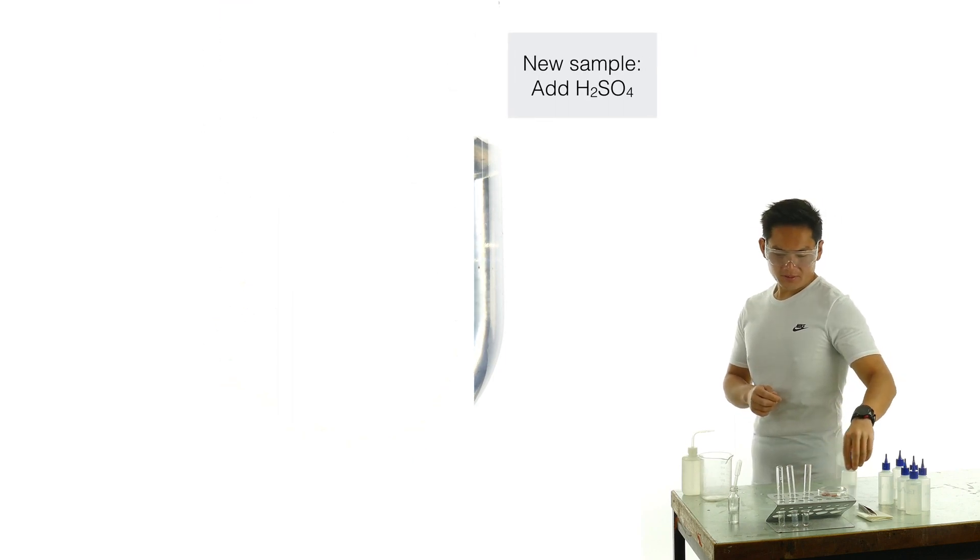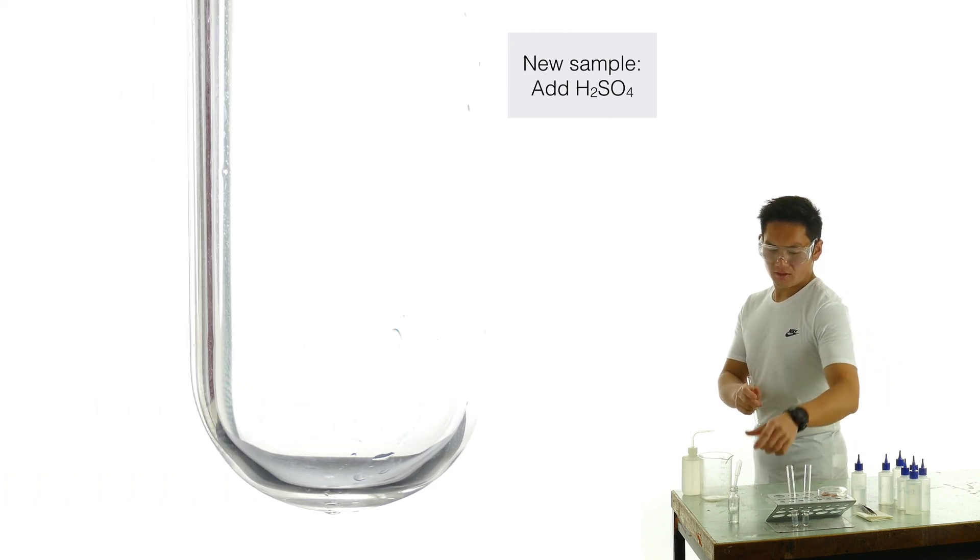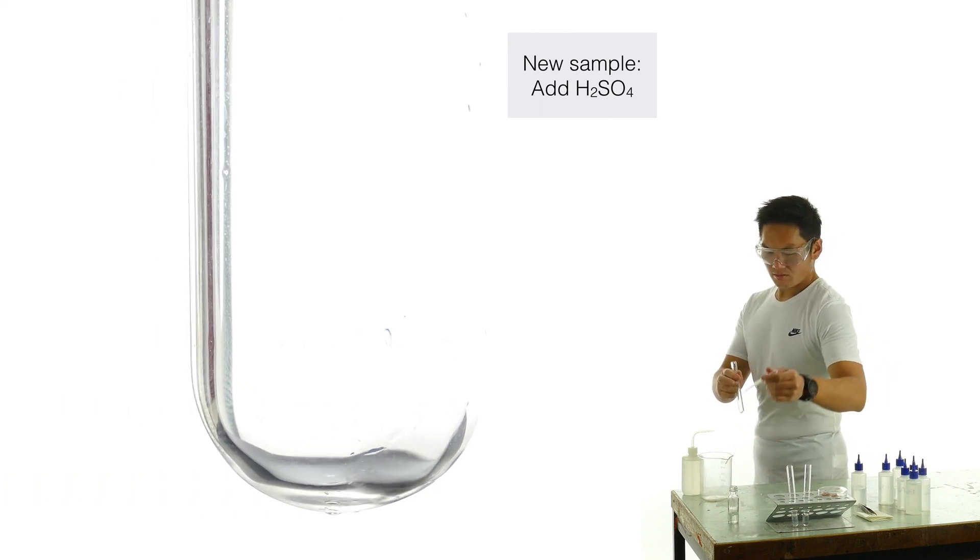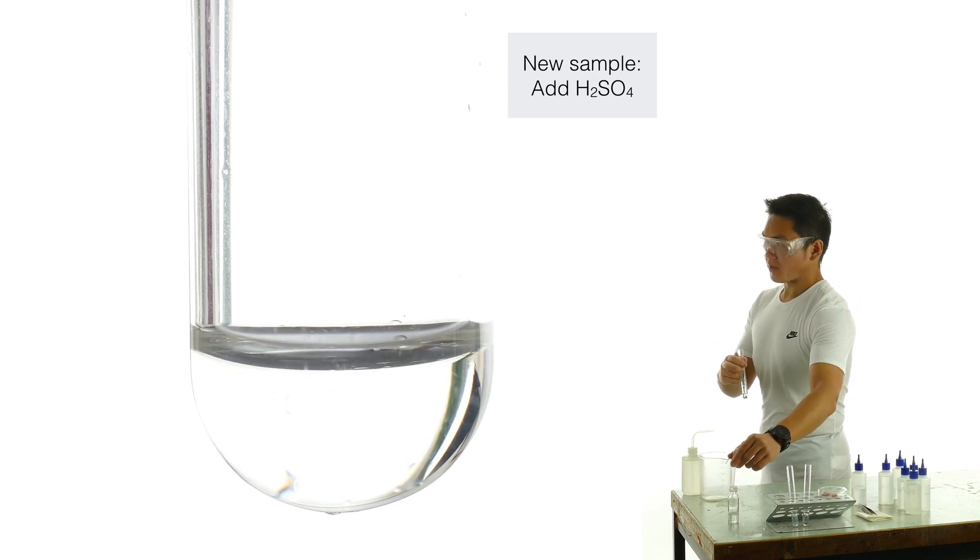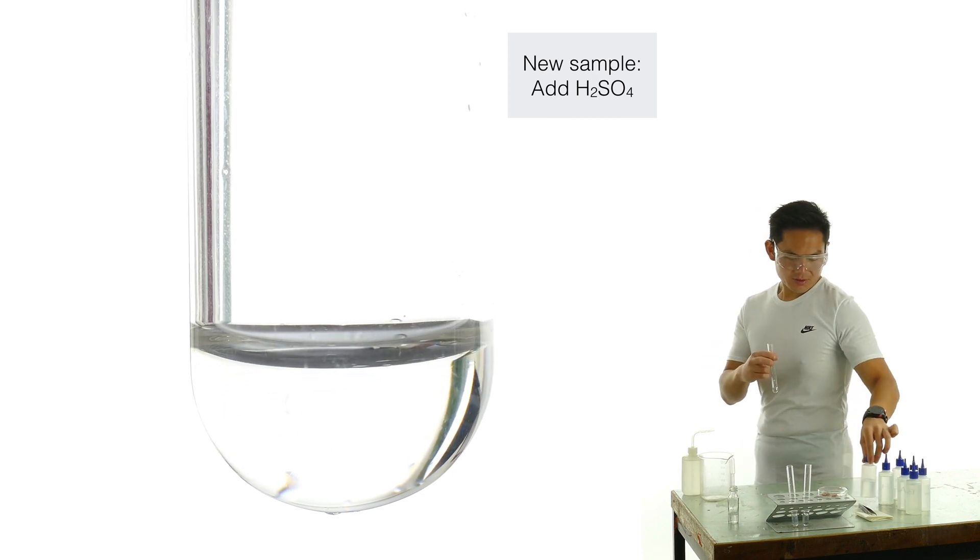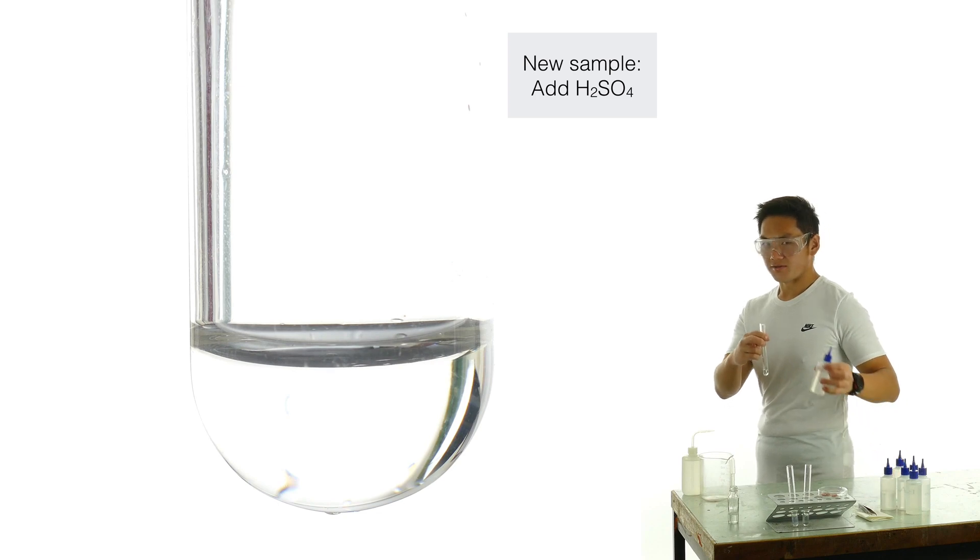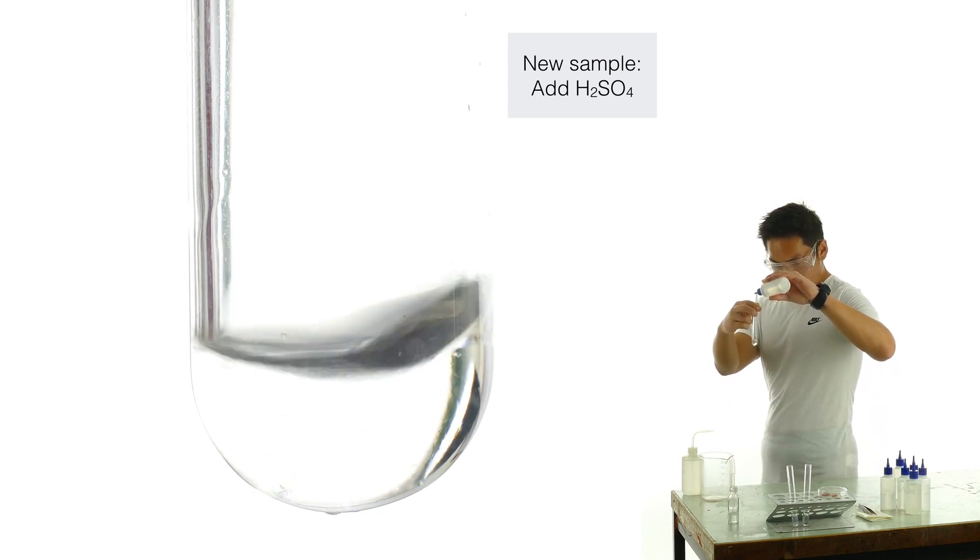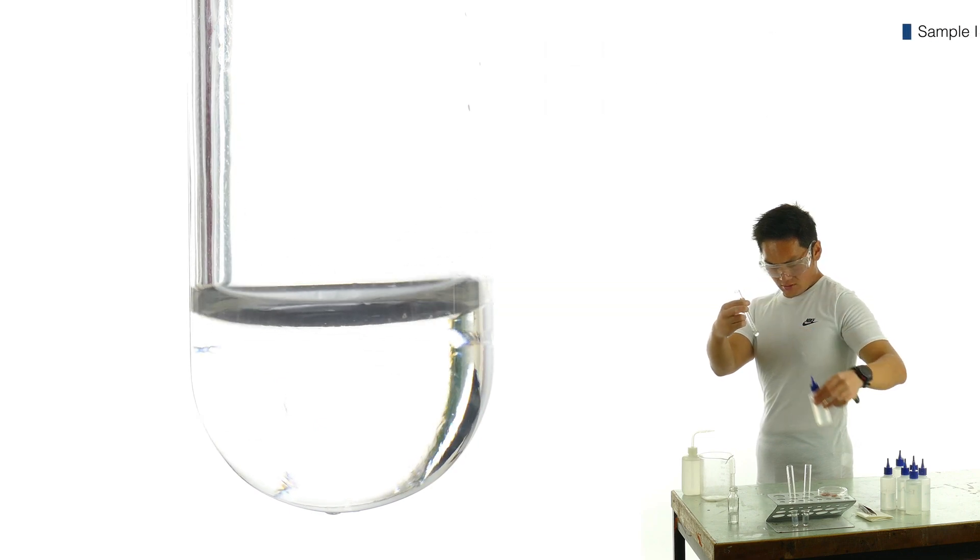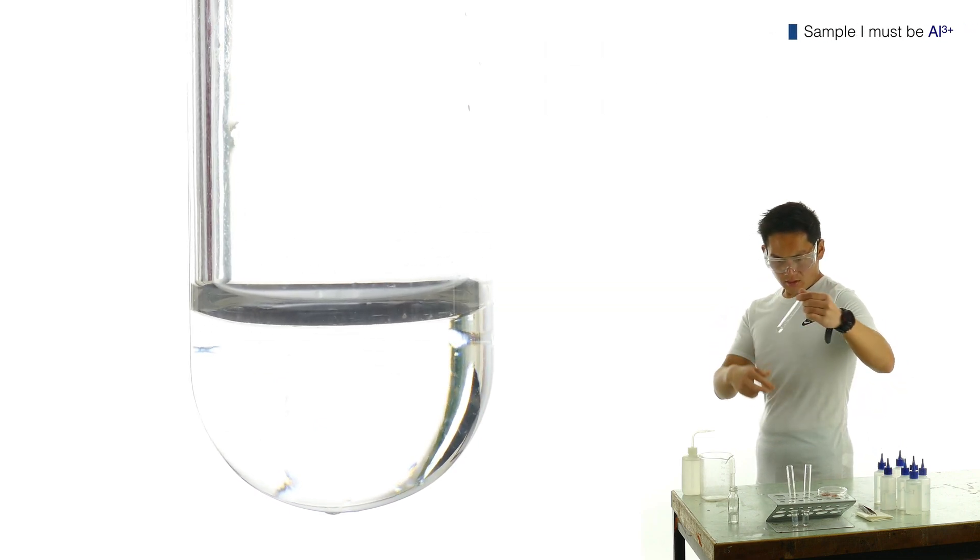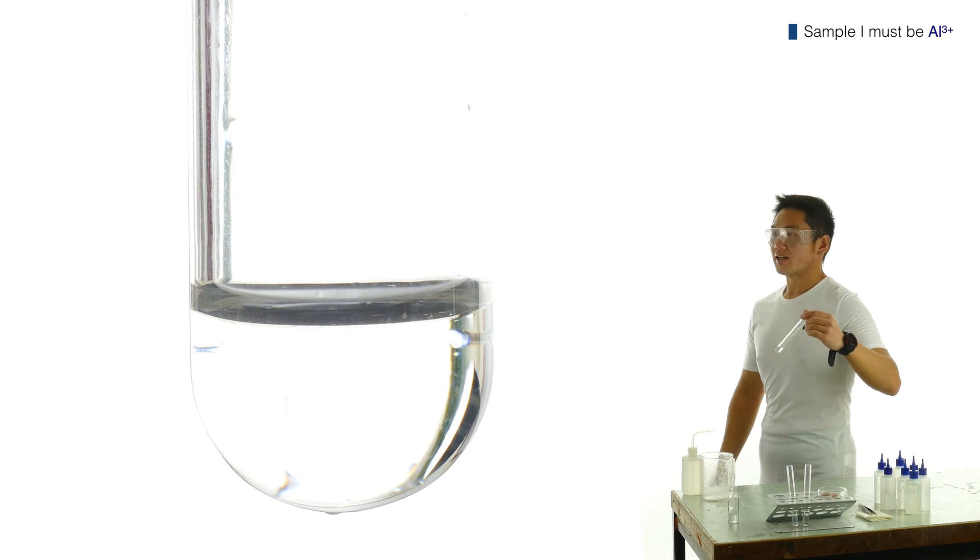I'm going to collect a fresh sample. And I'm going to add two drops of sulfuric acid, H2SO4. Nothing's happened, it's stayed clear and colorless.